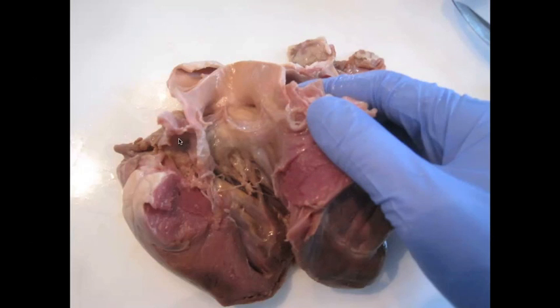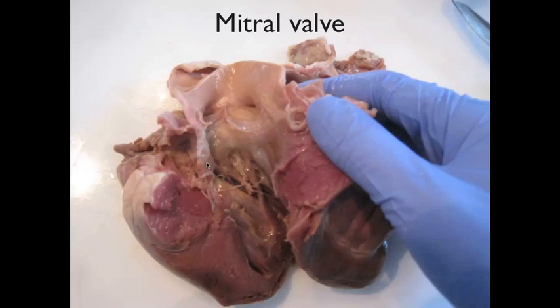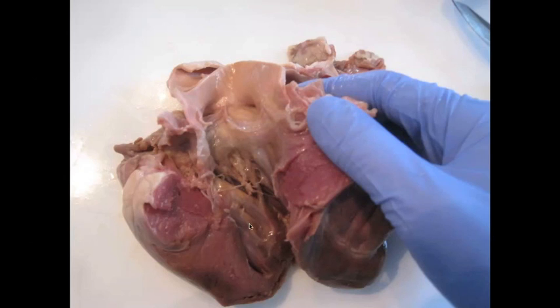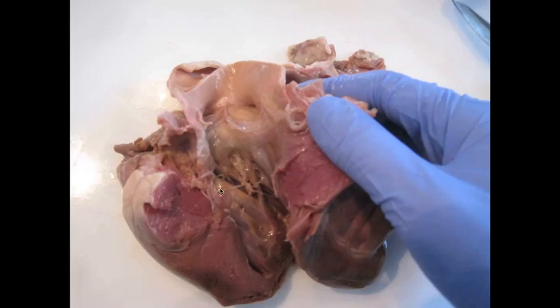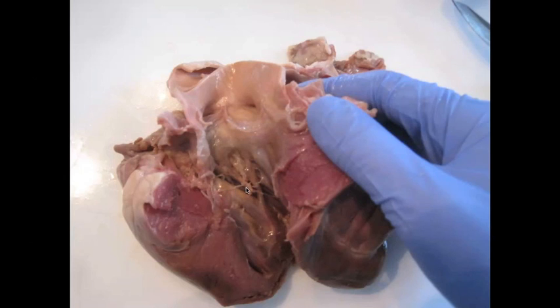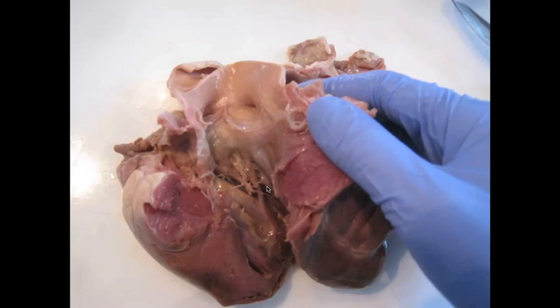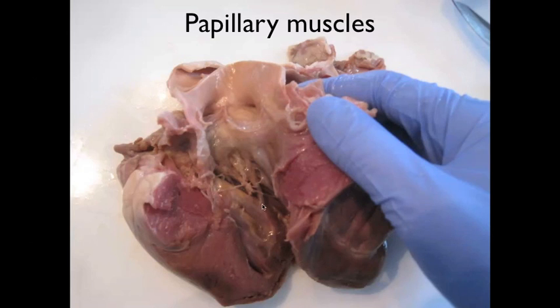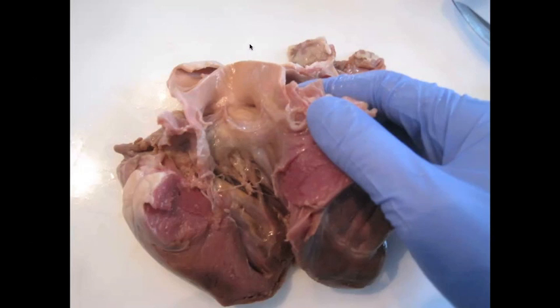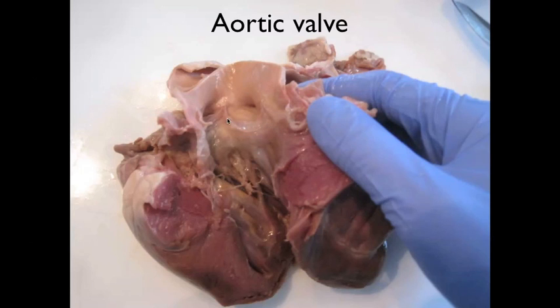Again, blood would flow through the left atrium through the mitral valve, which is shown here opened up, into the left ventricle. The chordae tendinae are visible, extending down into the left ventricle. They connect to the wall of the left ventricle via the papillary muscles, shown here. Blood would flow up through the aorta. You can see, opened up here, is the aortic valve.